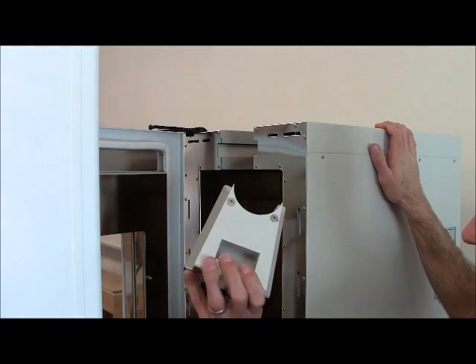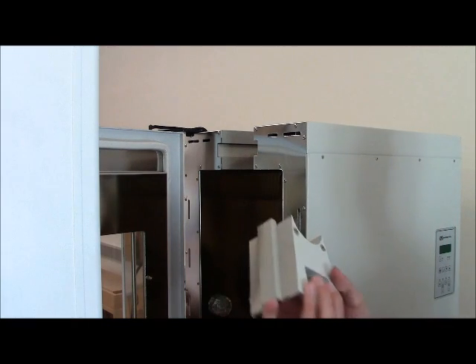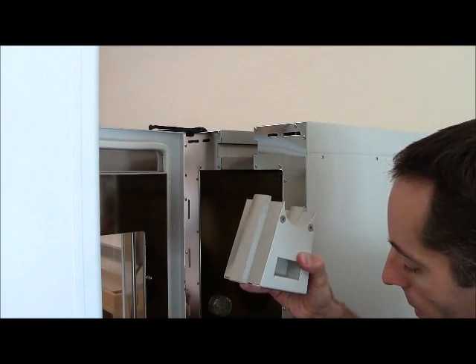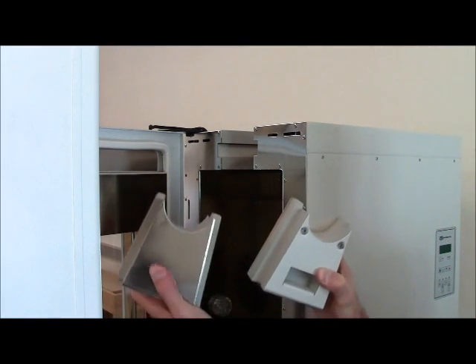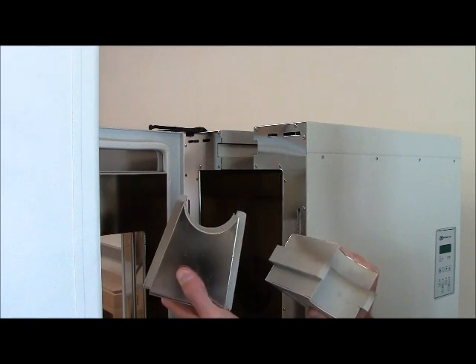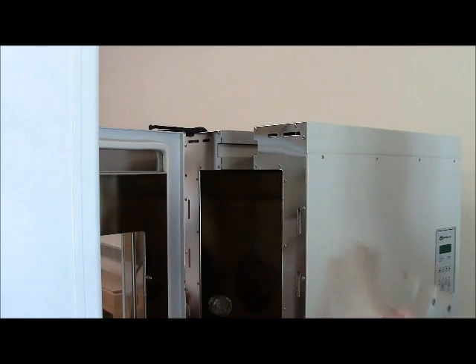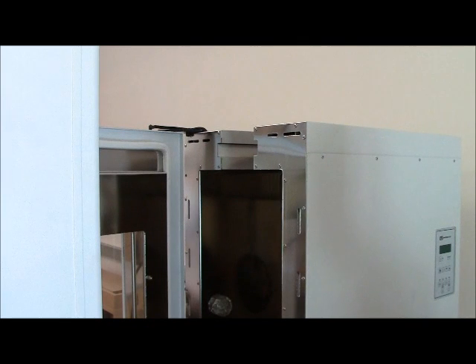Now you can't see the bottom of the oven but there's the exact same wedge at the bottom. I'll pull that out and you can see that they're identical. Again these get pulled out so that we can slide the oven forward and have clearance for the pull rods that are in place. These insulating wedges are made of a refractory material that we want to be very careful with as it is somewhat fragile.